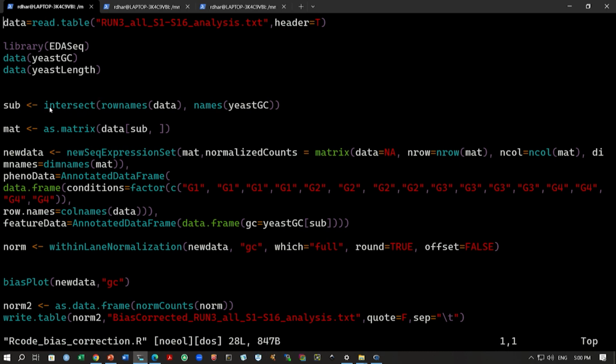The first part is looking at the intersection between the row names of the data. So, what are the row names of this data that we have loaded? These are the gene names. And the yeastGC data also has names, and these names are gene names, and we take only the intersection, wherever we see the common genes across these two data sets. So this is the command: sub intersect row names data, names yeastGC.